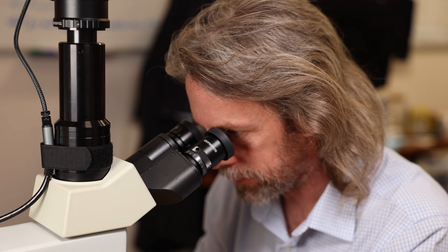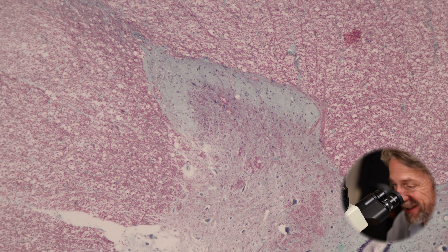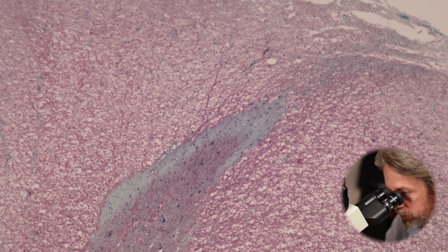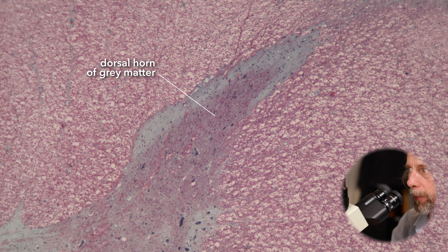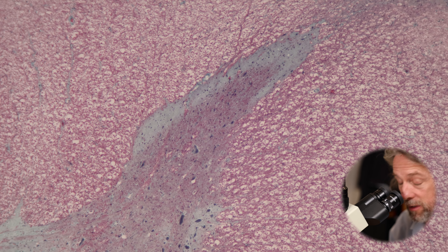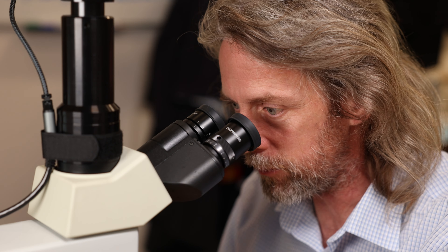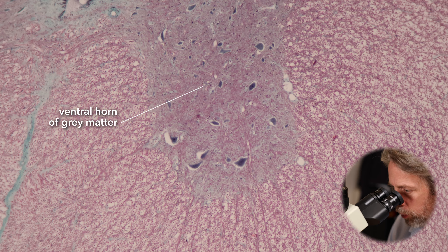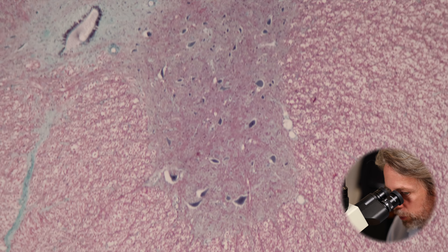There's the middle — that's the central canal, we'll come back to that. That is the dorsal horn — I'm confident of that, particularly on this side, where we can see it reaching to the edge. How this looks will vary depending upon the level of the spinal cord and the plane of section. At the neck and the lumbar regions — where you have the lumbosacral plexus and the brachial plexus — the gray matter can look quite different due to many connections running out to the limbs. And there's the ventral horn, quite a long way from the edge.